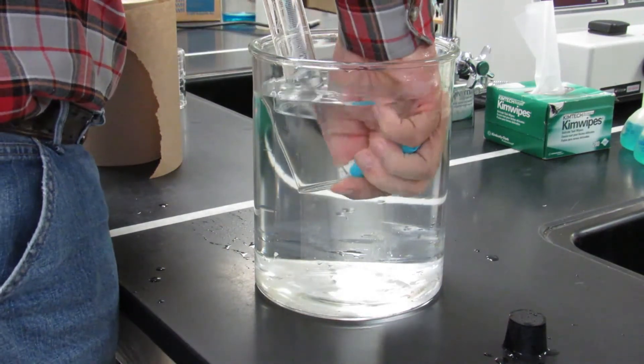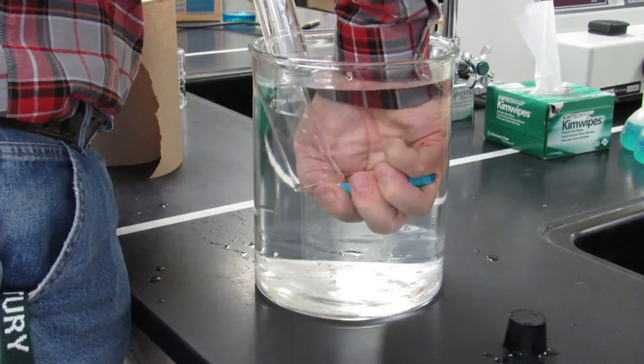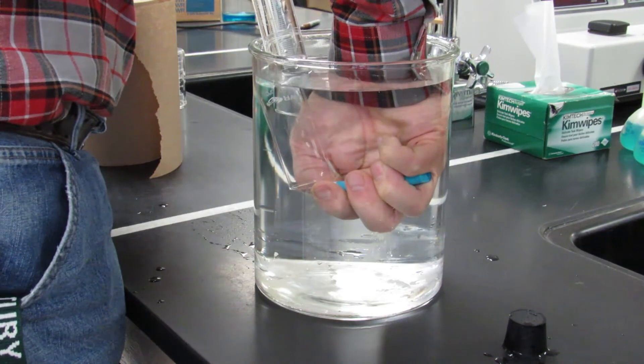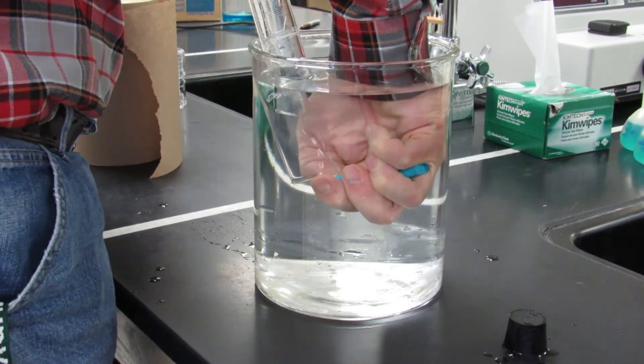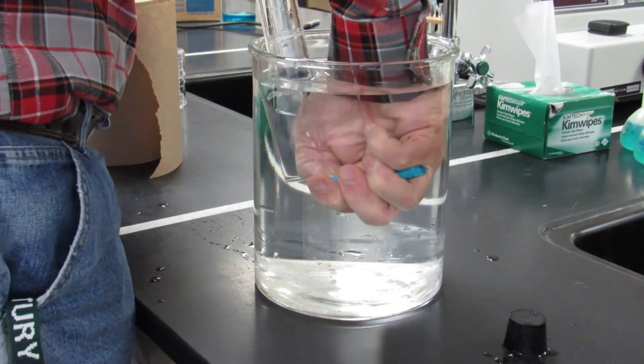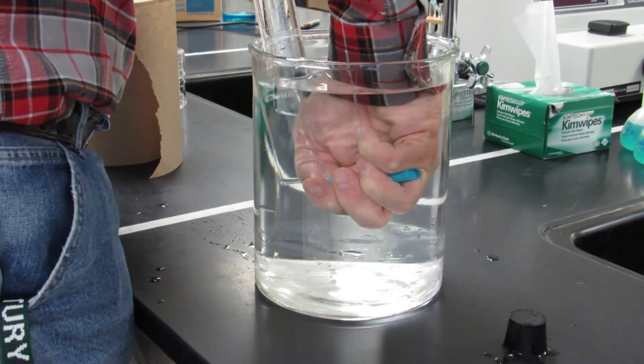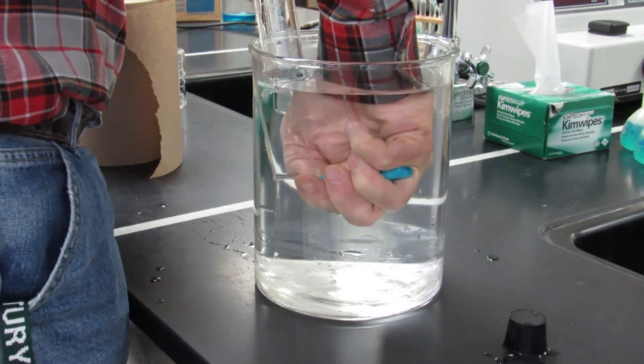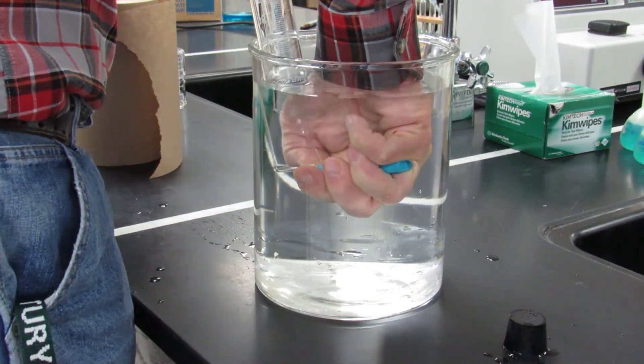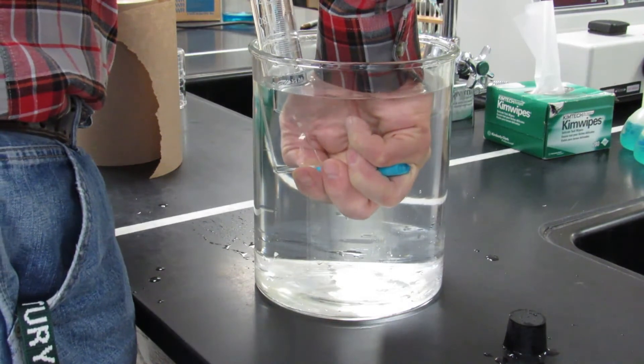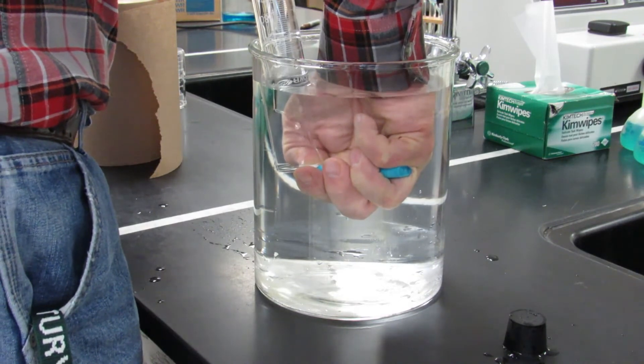So it's just gonna take a little bit of time. Now it's moving a little faster now, and we have to collect anywhere from 95 to 100 milliliters of butane from the lighter. Now one of the tricks to doing this is just patience. You don't want to have the gas not go into the graduated cylinder, so patiently wait for it to fill. Based on time frame, it's probably about 30 to 40 mL, so we're about 40% done.